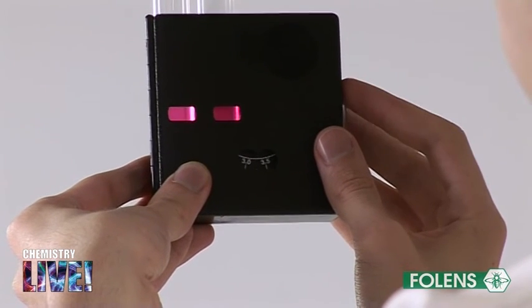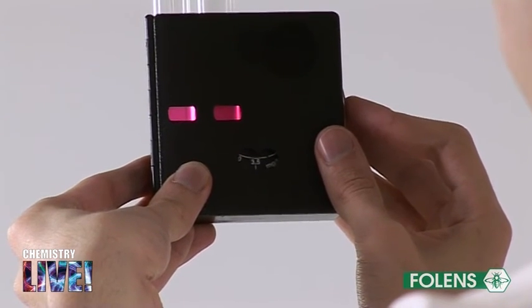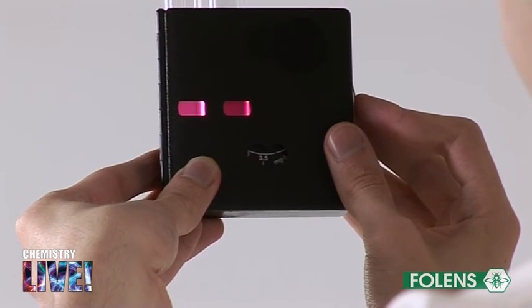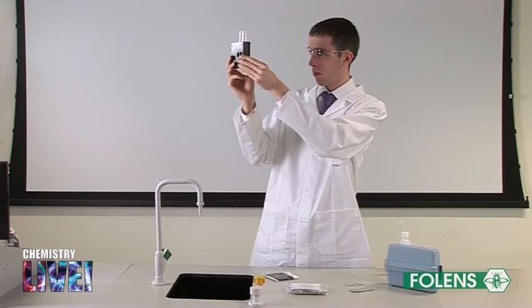Immediately read the number visible through the opening at the bottom of the comparator box. This gives the value of chlorine dissolved in the water in units of milligrams per litre or ppm.